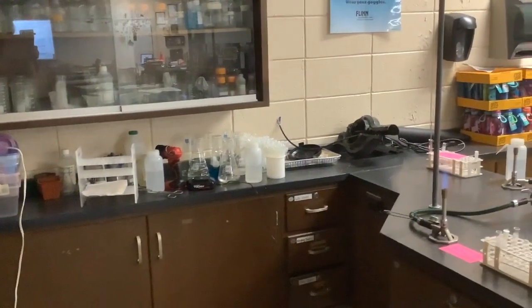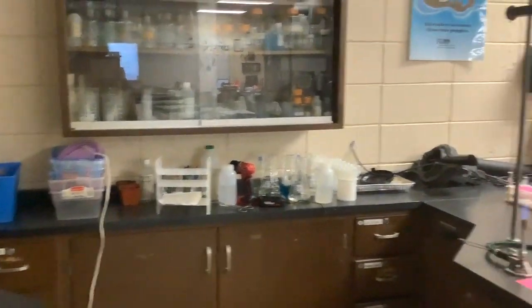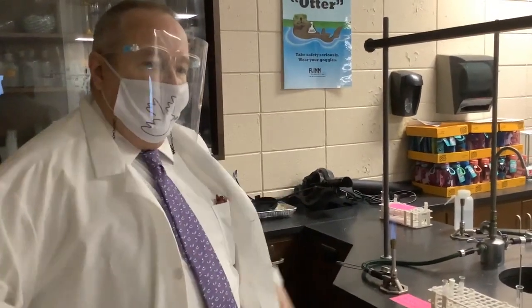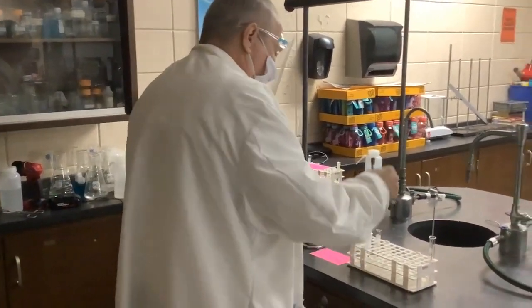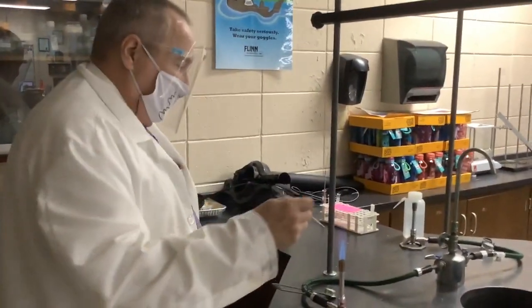And now, in the order the different elements are listed in your lab report, we're going to first look at a tube of barium chloride. I have a nichrome wire loop.